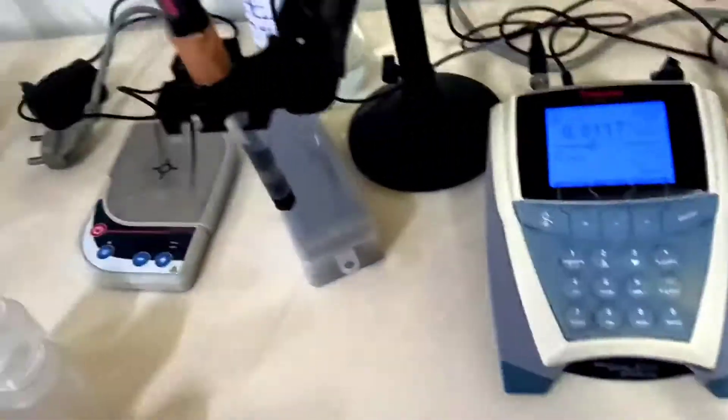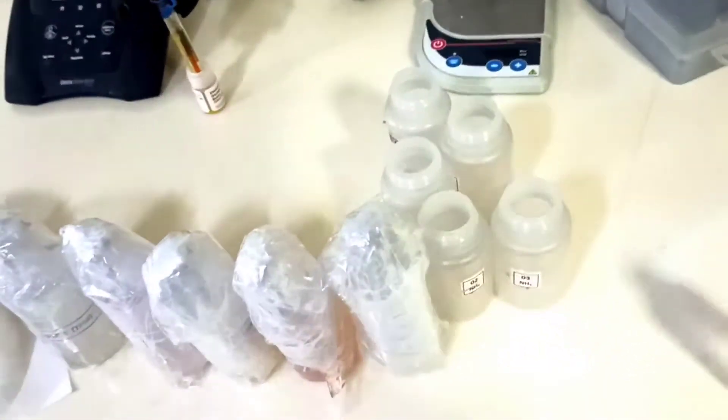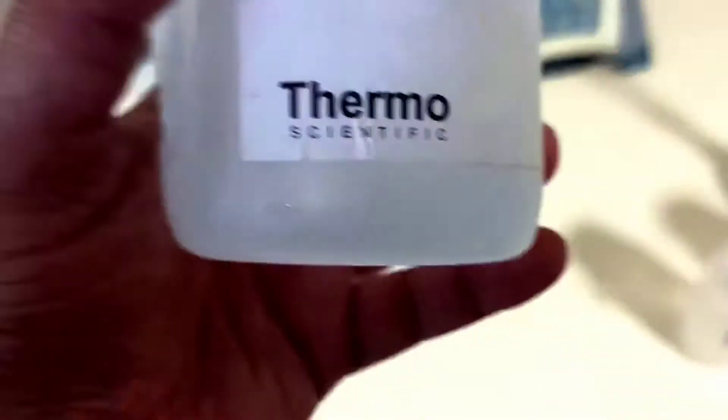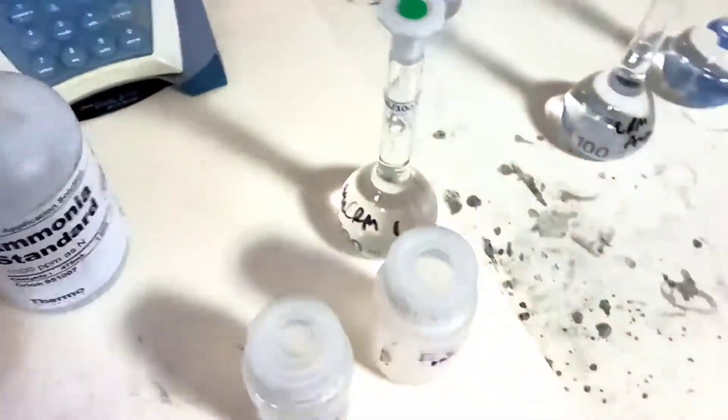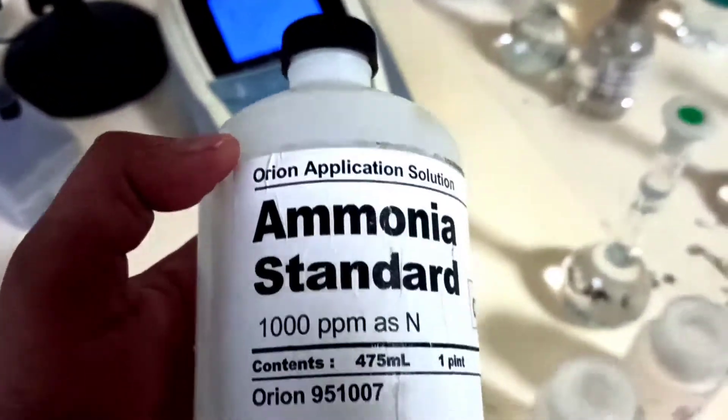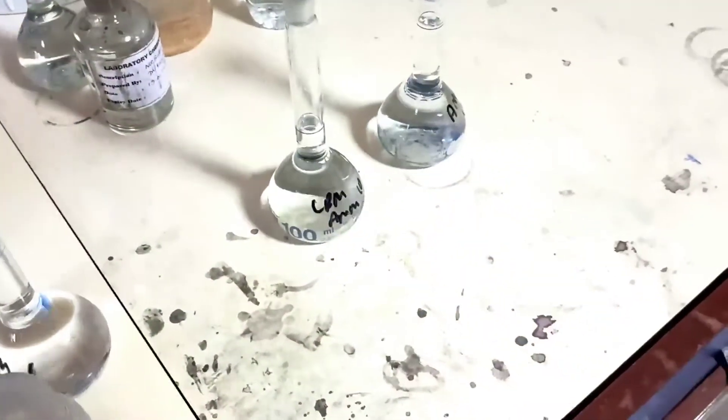We prepared three standards from a thousand ppm standard solution - CRM, certified reference material, ammonia standard. Just in front of me you can see thousand ppm as N.